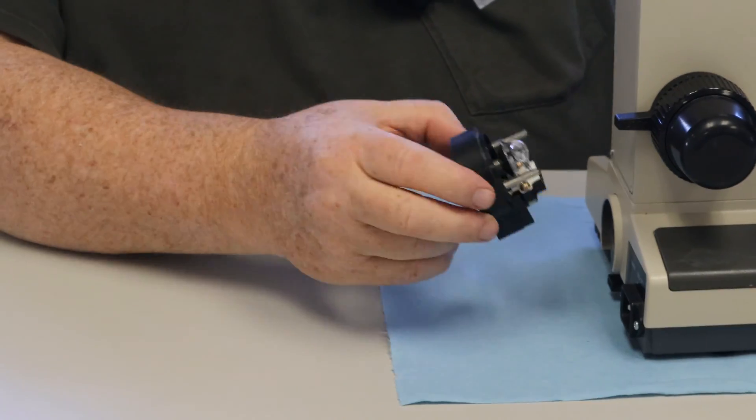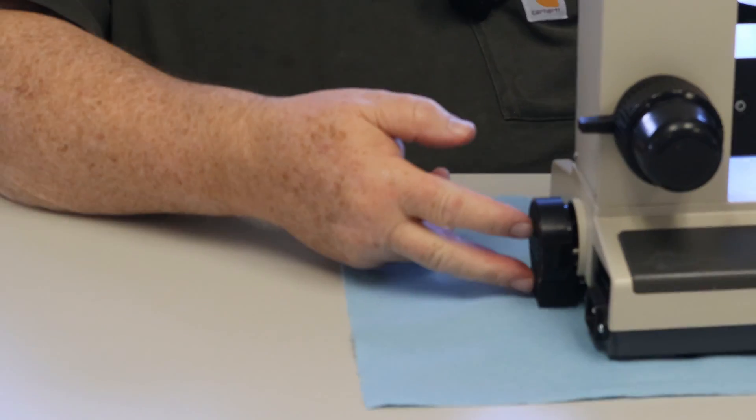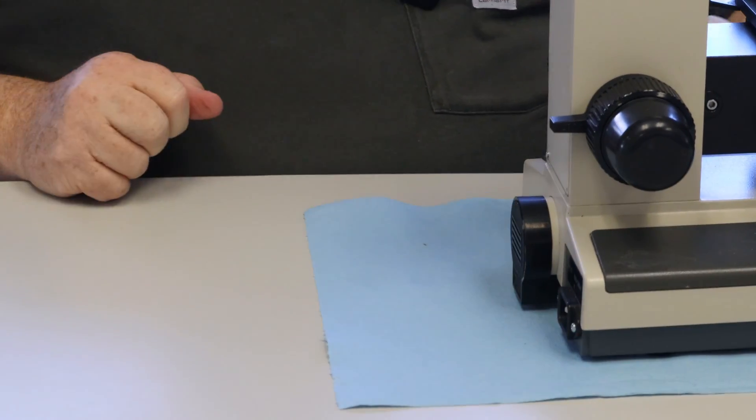It's simple. Use the guide pins again, you got it back in, push firmly. At that point you have changed the bulb.